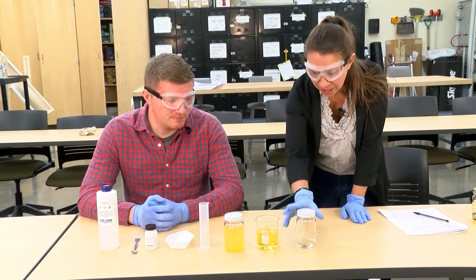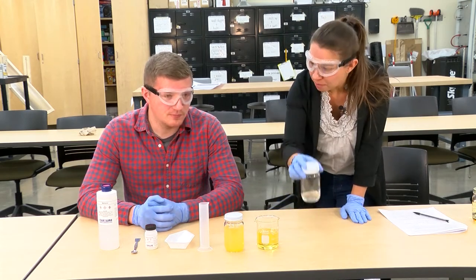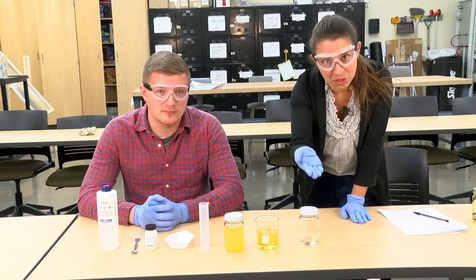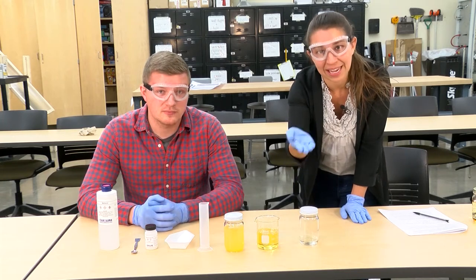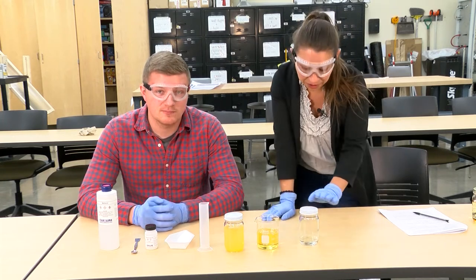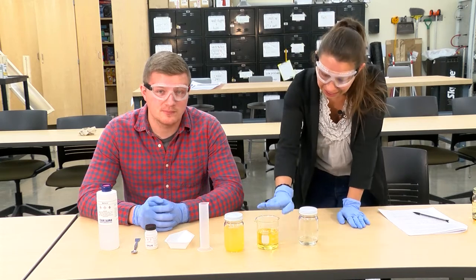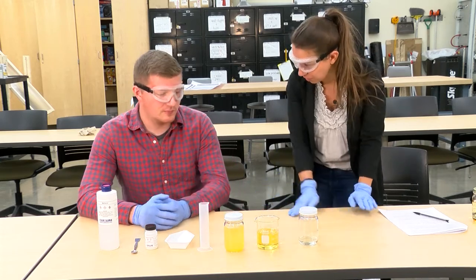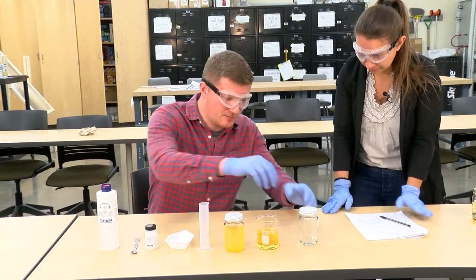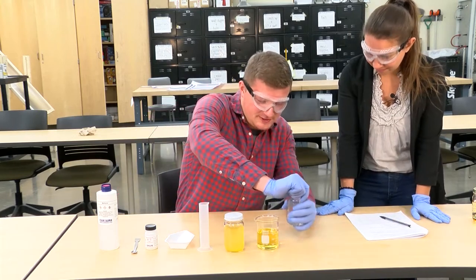We have some methanol here — methanol and, of course, our catalyst. Our catalyst is methanol and potassium hydroxide. Here we have our oil, and what are we going to do? We're going to mix these two together and separate those triglycerides.